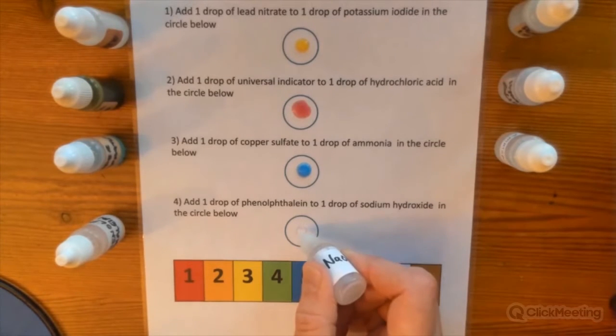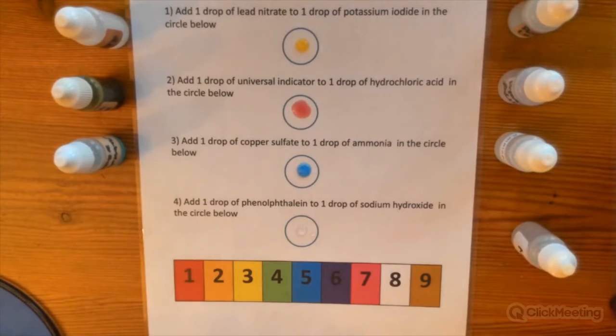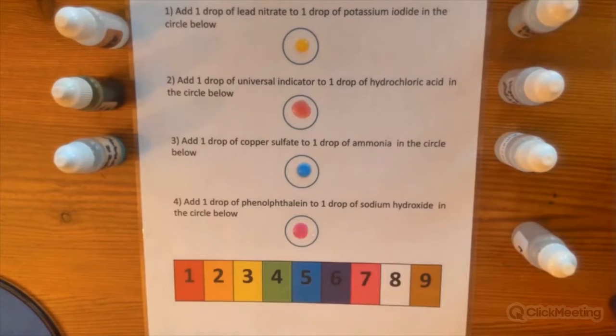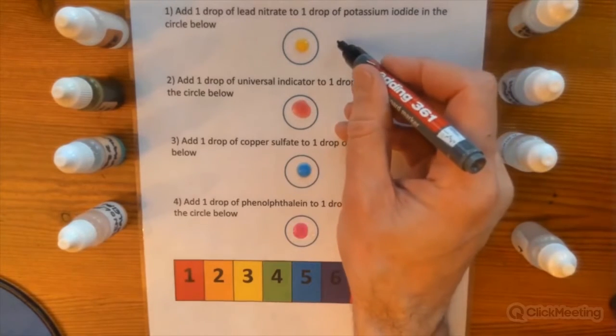The final one is one that's typically used for titrations. We've got some sodium hydroxide added to some phenolphthalein. Now, the advantage of this experiment overall is that the cleanup, the dropper bottles get collected and put away, and the sheet is rinsed down the sink very quickly with some water and wiped with a cloth, as opposed to having to wash out lots of test tubes with a test tube brush and put them in a rack to dry.